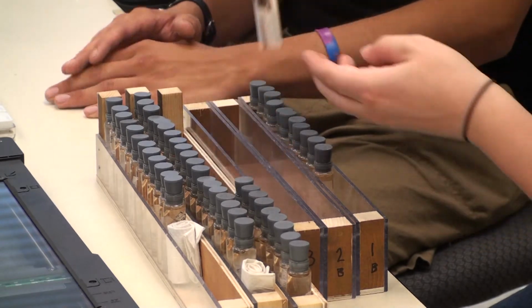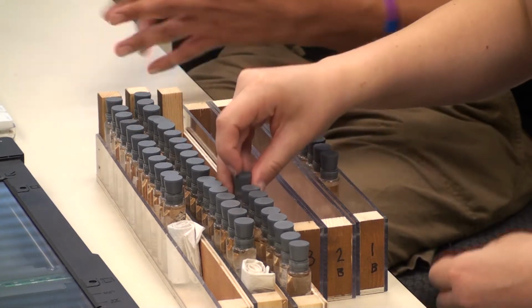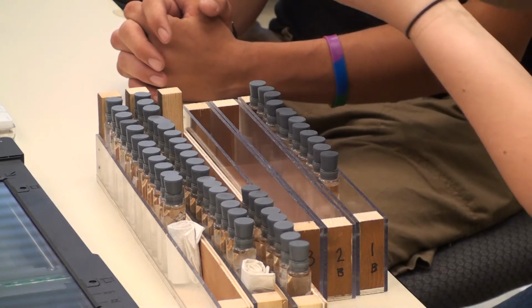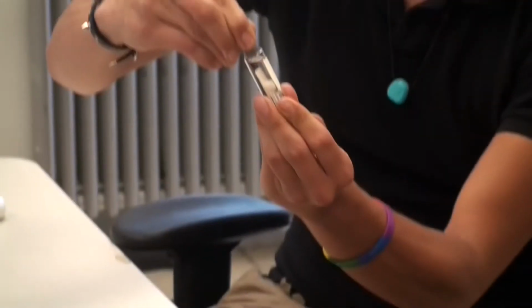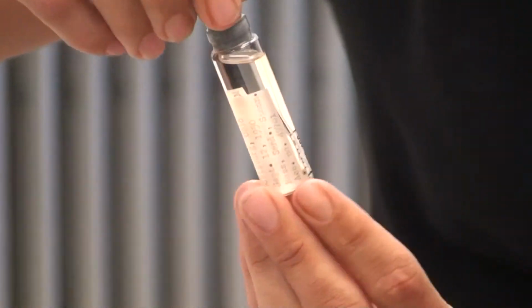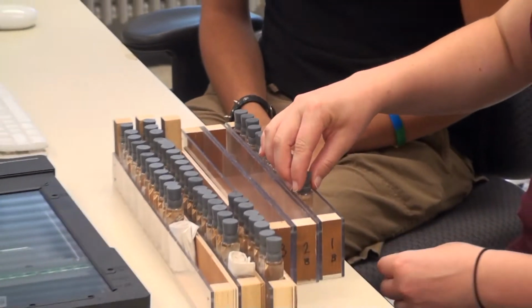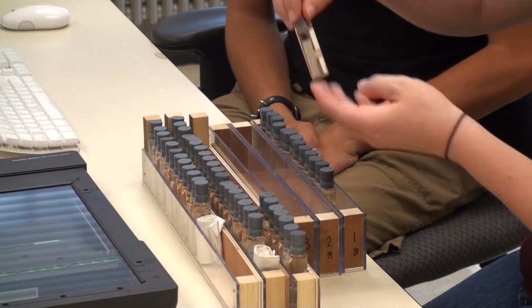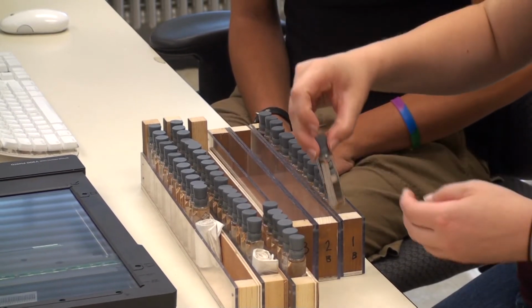This allows for rapid access to this information. It also allows you to profile your collection while you're doing it. As you're doing this, you can see if a vial is in poor condition or great condition. You see that one, the stopper is nice and it's not degraded in any way. The alcohol is pretty clear and it's topped off. So this tells you that that vial is all right for now, but you will come across vials that might need some more attention, and so this does allow for a little additional profiling while you're imaging your collection as well.